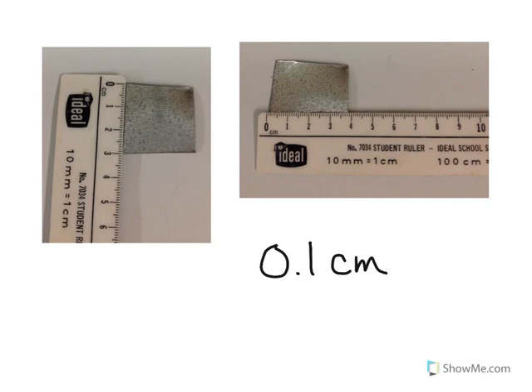Due to the irregularities and shapes of the pieces, measure the length and width of the piece of galvanized iron using a metric ruler, recording to the nearest tenth of a centimeter.